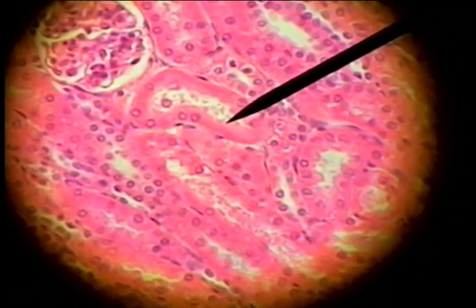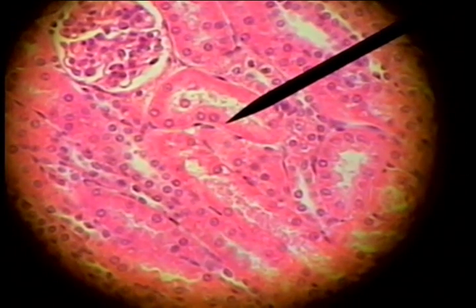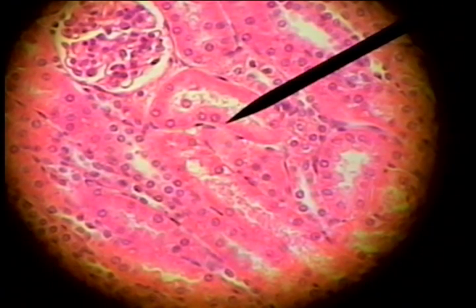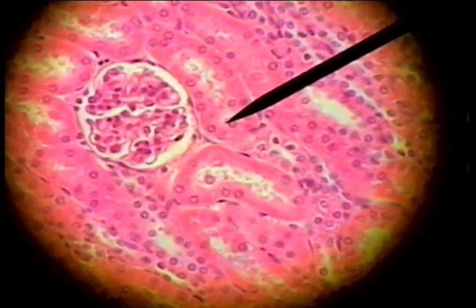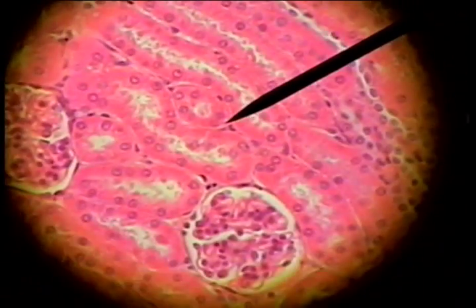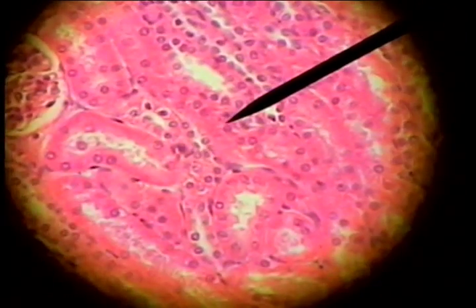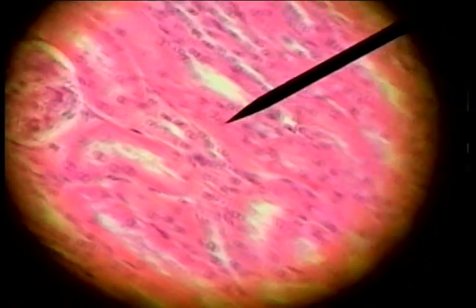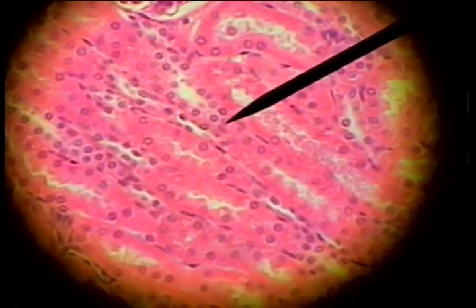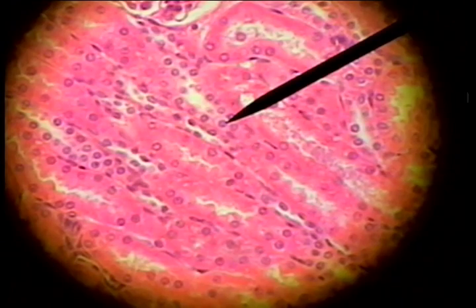These are tubules, and these darker or more reddish stained structures are proximal convoluted tubules made up of cuboidal shaped cells. Here's one here — this would be sort of an oblique cut, and this would be more of a circular or transverse cut of cuboidal cells. Proximal convoluted tubules stain more densely pink, or eosinophilic.